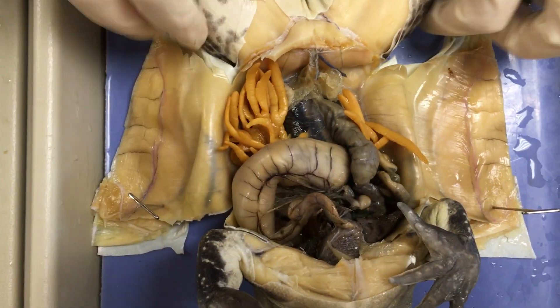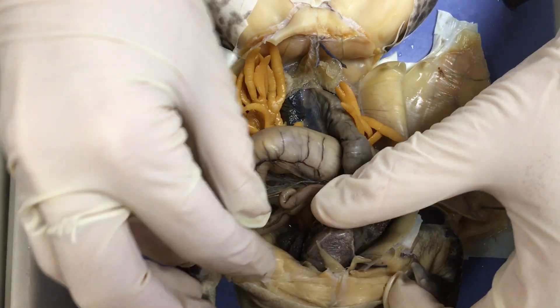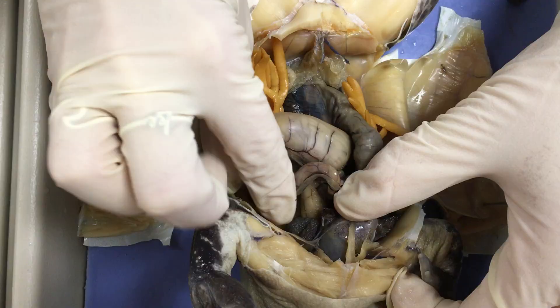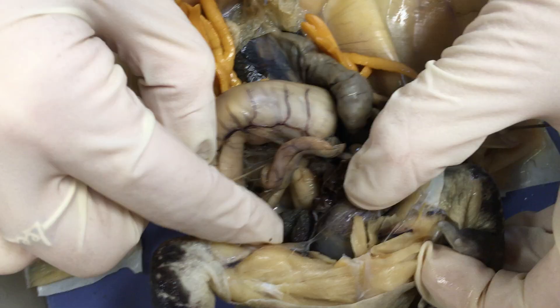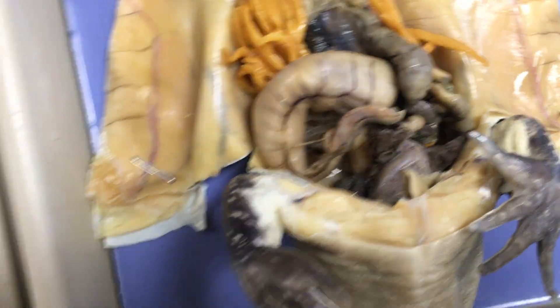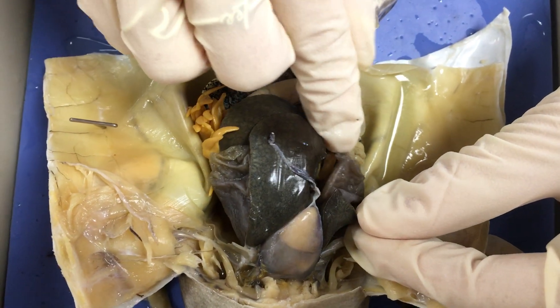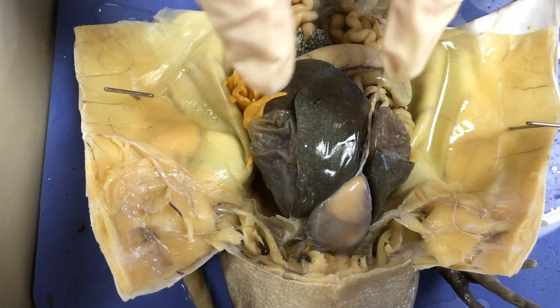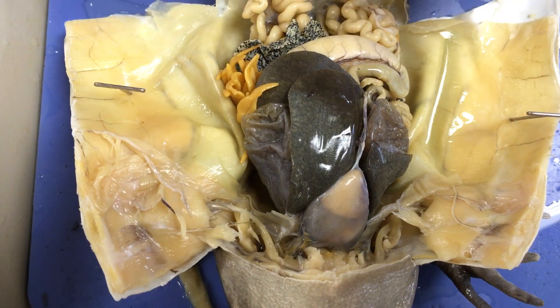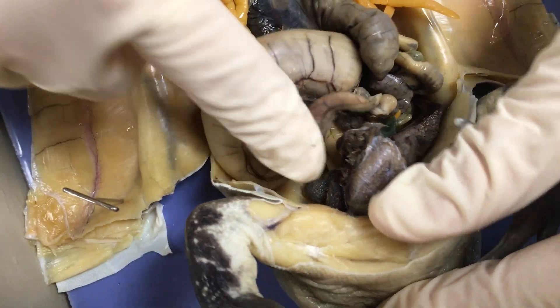Once you've removed that structure, it gives you a better look into some of the other organs behind it. Back here, there's this small little structure — there's one on the other side, though a little piece of the liver is kind of obscuring it. This is one of the lungs of the frog. There's a better example over here — it's this larger, kind of deflated balloon-looking structure. In some examples, it kind of blends in with the liver, so make sure you distinguish between the lobes of the liver and what are lungs.